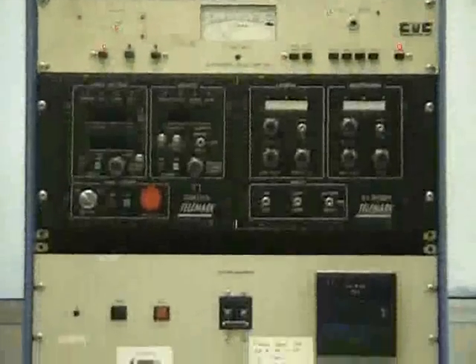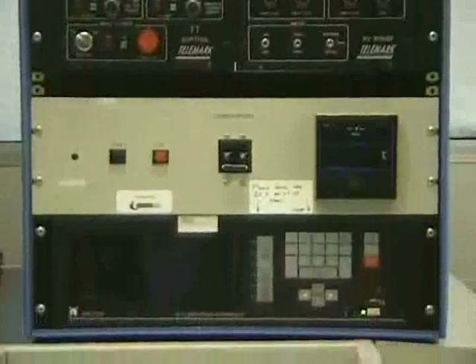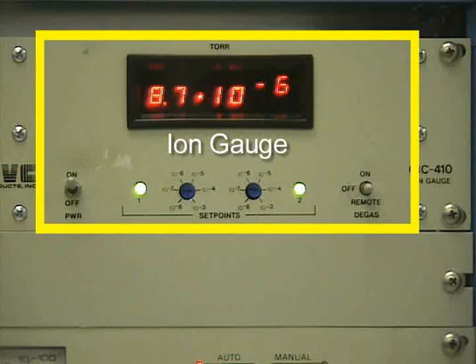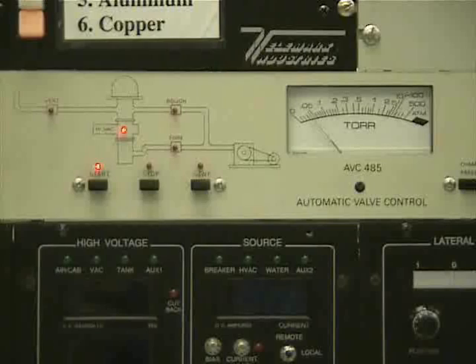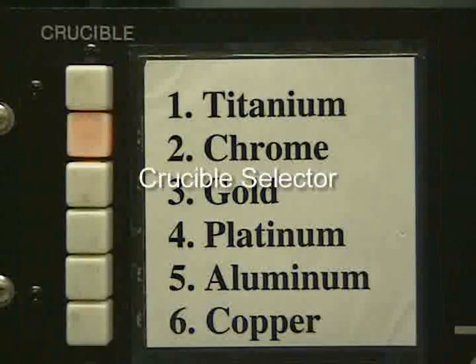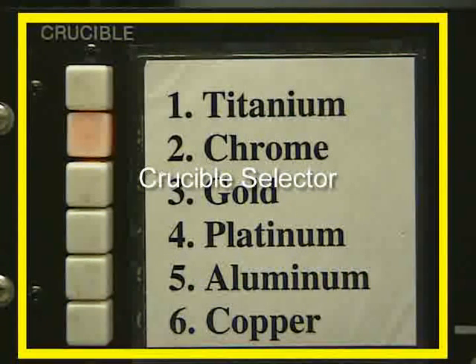We will now go over the various parts of the E-beam evaporator. We will begin with the ion gauge. It is used to display the chamber pressure when the chamber is under high vacuum. The pressure is measured in torrs. The valve controller controls the valves that are used to control the chamber pressure. The gauge in the middle of the controller shows the chamber pressure in torr. The lights on the left side of the gauge show that a valve is open when the respective light is on. The crucible selector moves the selected crucible into position for evaporation.